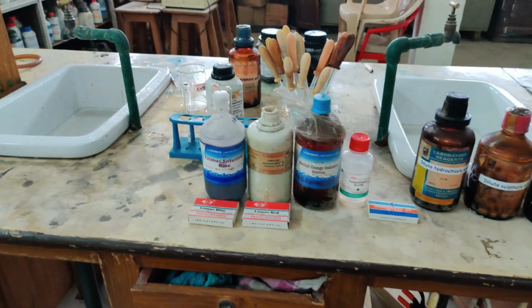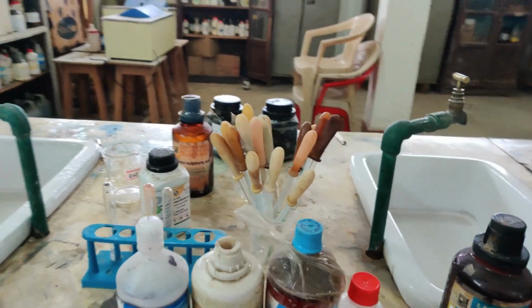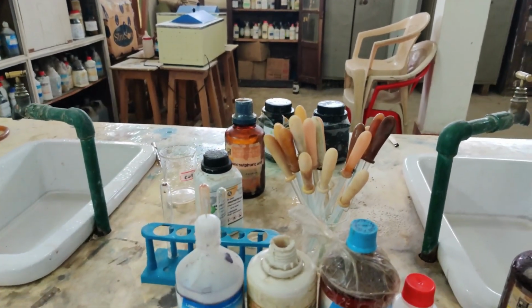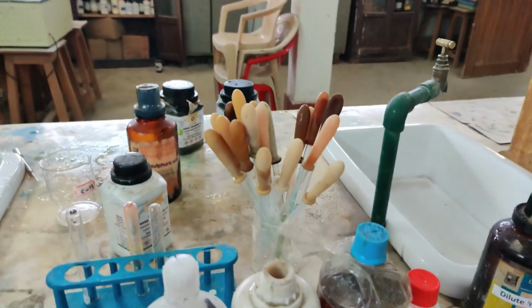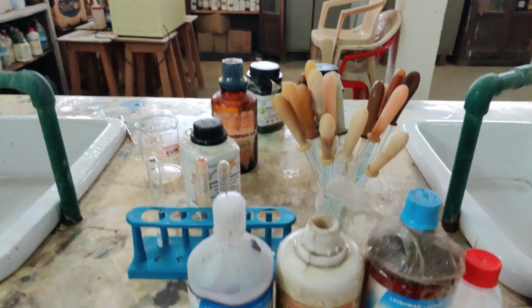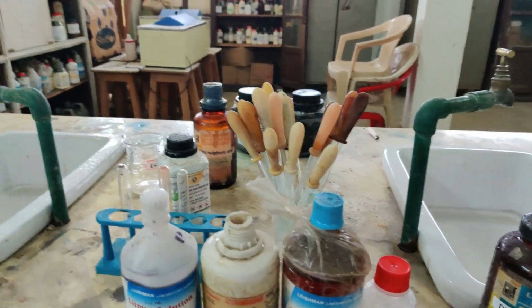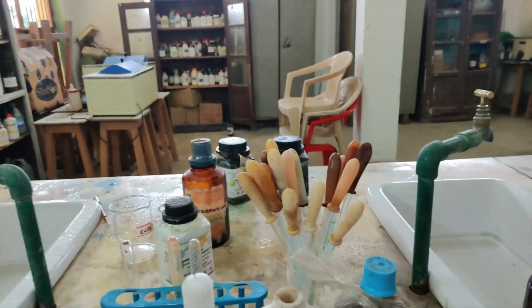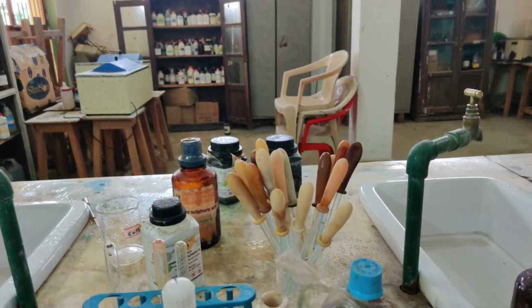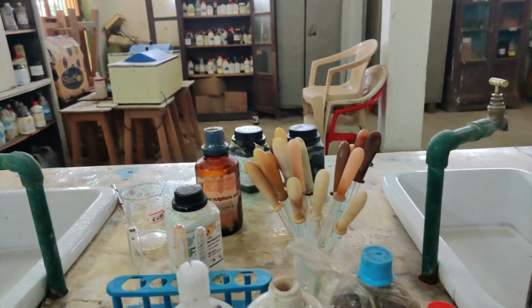As promised in my previous class, I will be showing you practically the change in the indicators, three common indicators. I told you about three common indicators. They are litmus, and the other one is methyl orange. Then you have phenolphthalein. I am going to show you today, by testing acids and bases, how they respond and what color changes are seen when an acid or a base is tested. So let us first talk about only your common indicators.